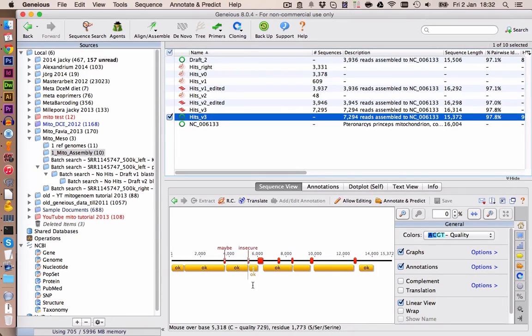We especially have the problem with areas of low coverage and some mistakes in the mapping, where the blast search has detected some reads where it was thinking it's mitochondrial, but it probably isn't, so it doesn't fit very well. So at the moment I'm not exactly sure if our method is suitable for actually assembling a mitochondrial genome when the reads are very short, but we are just going to continue working on it and see if we can get something useful. If it doesn't work, we probably have to search for some alternative methods.